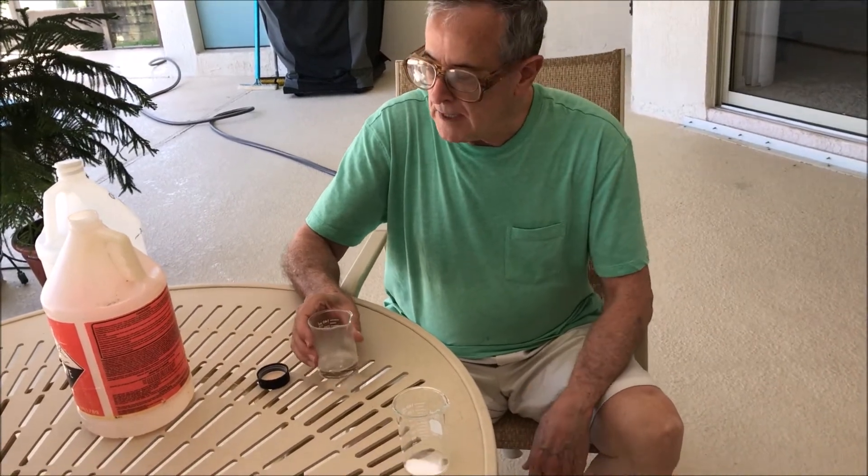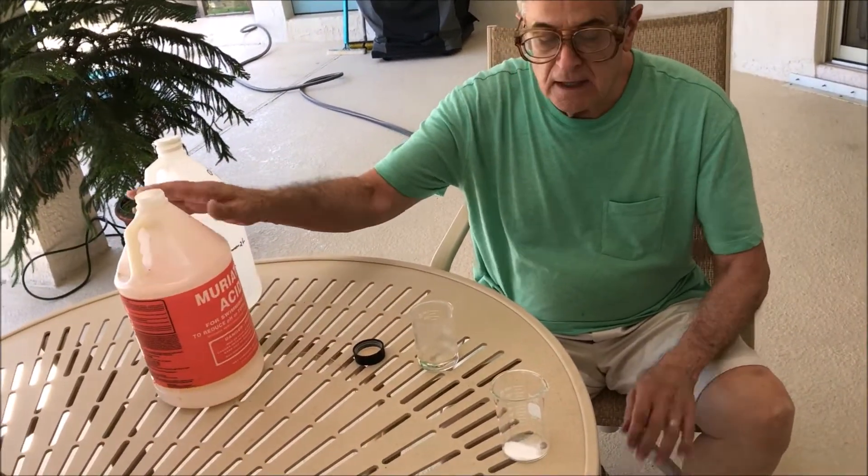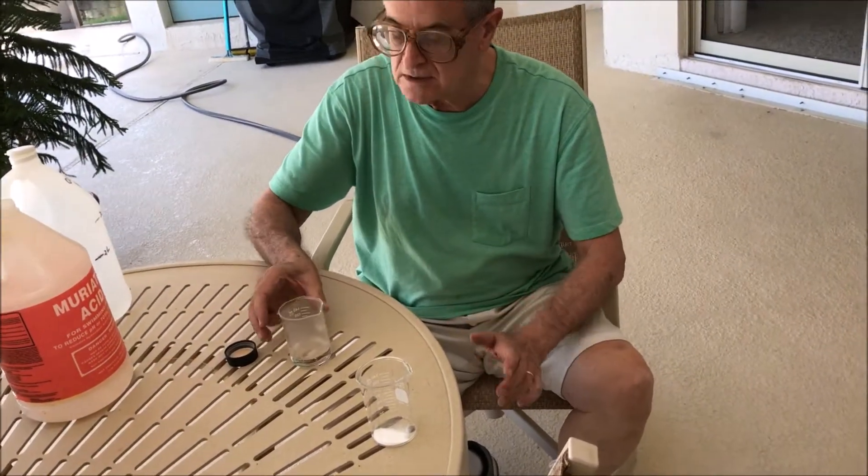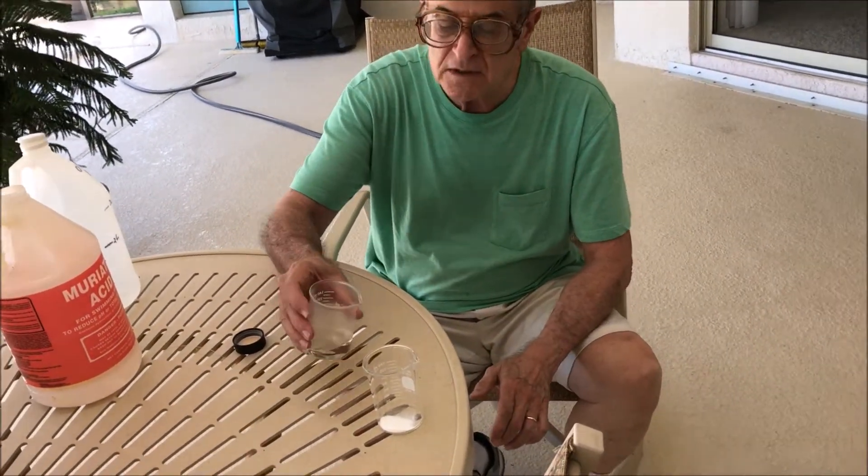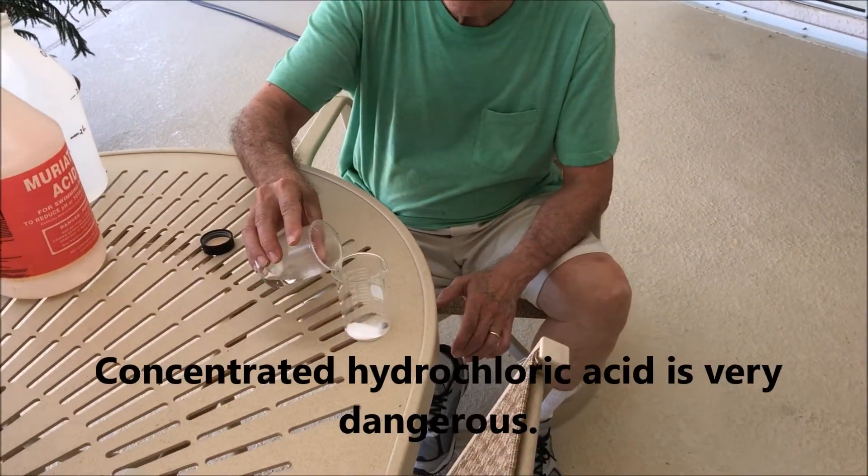I'm going to add hydrochloric acid to the sodium bicarbonate. It's fairly concentrated—31%—so I'm just going to add a little bit at a time.